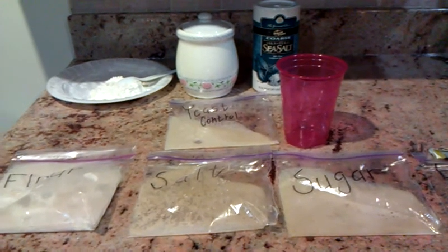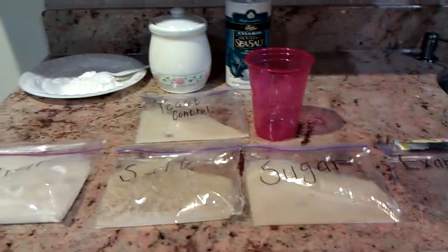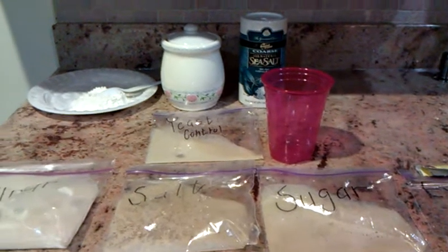You may only work with one partner. I will perform my experiment as you can see that I have set up here today. I will explain it in a moment. I know you probably are a little bit lost, so I will do my experiment so you guys have an idea of what to do.